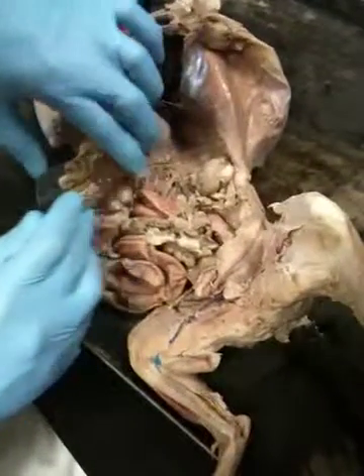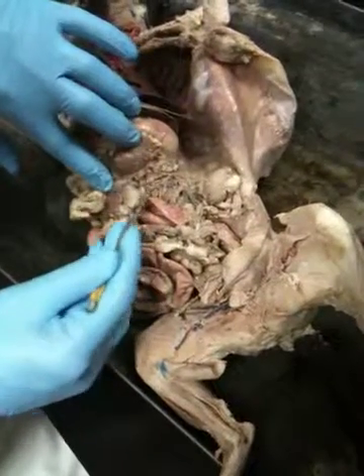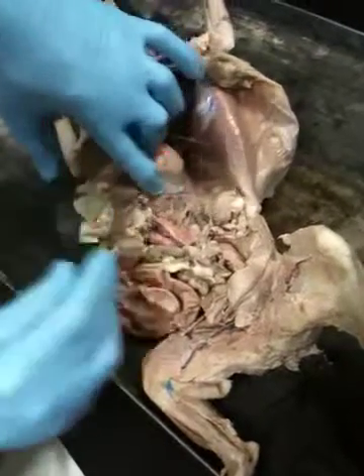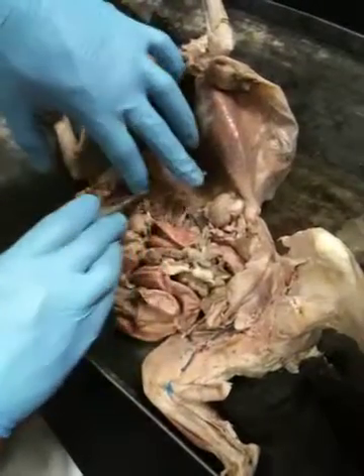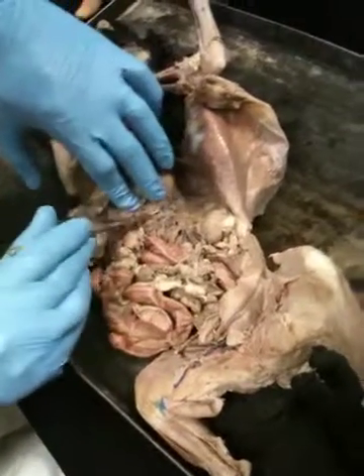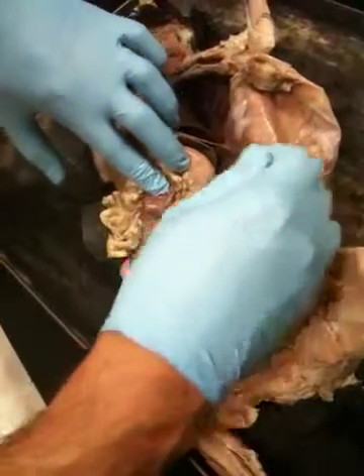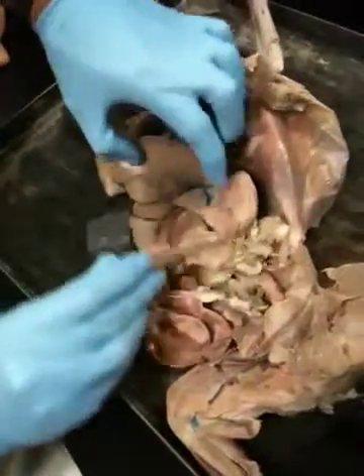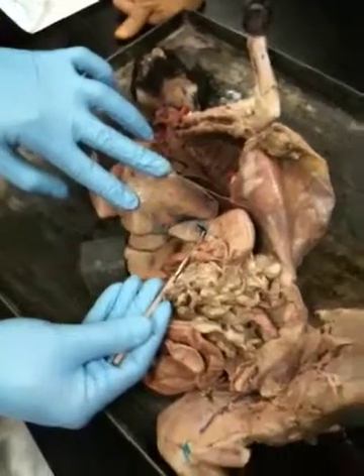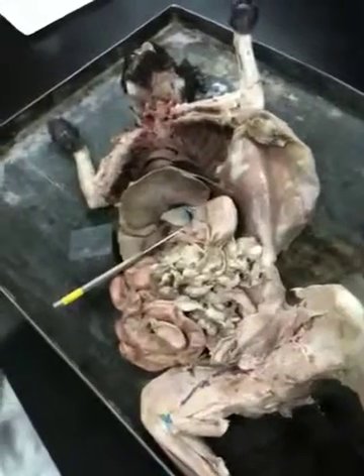So one of the branches, it looks like, is going to the spleen. That would be the splenic artery right there. You guys see it? Okay. Another branch is going to the stomach. That would be the gastric. You have to do some cleaning up, but it might be right here. So you see it? No. Right here. Gastric, splenic, and one goes to the liver. So you could probably pick it up right there. Hepatic artery. So all three of them connect to the celiac trunk.